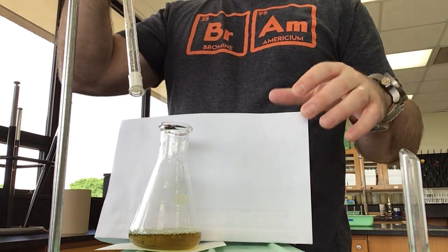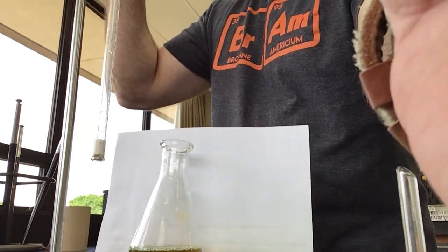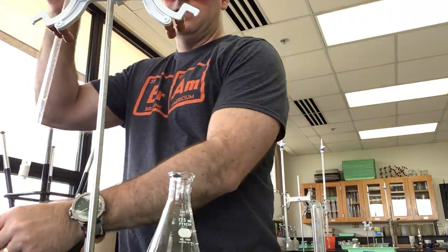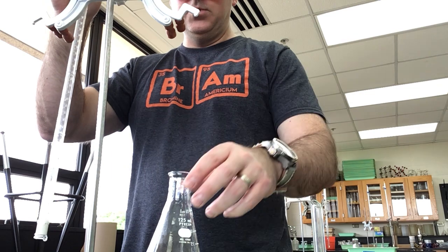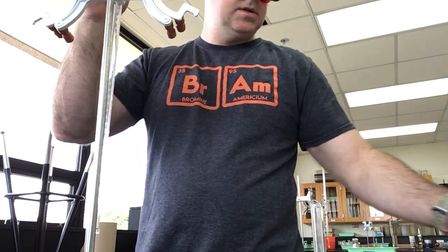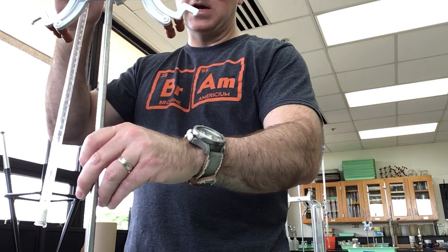All right, when we store our burette we want to make sure that the tip is up to the sky.